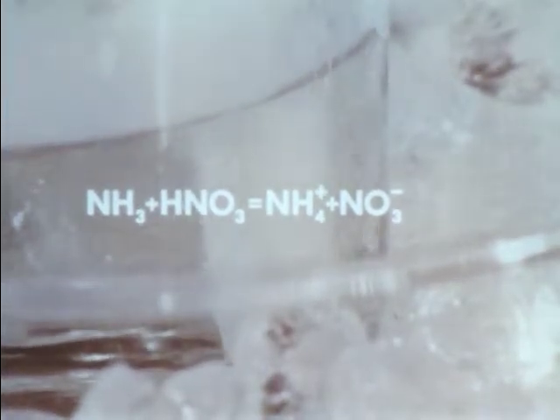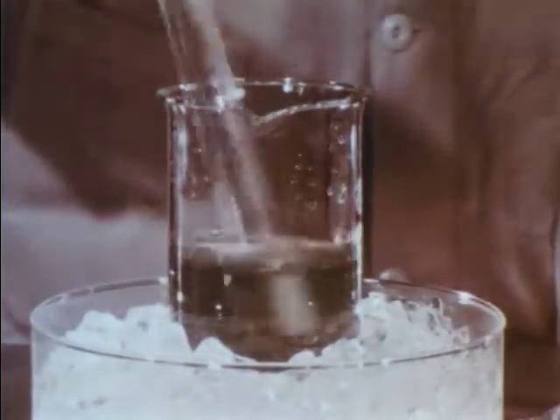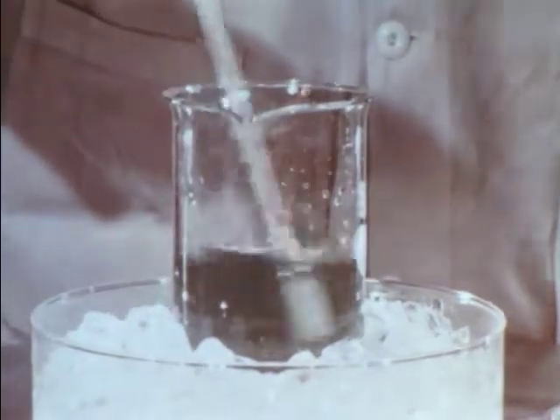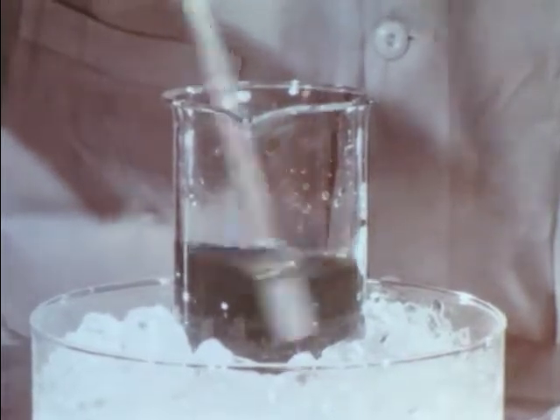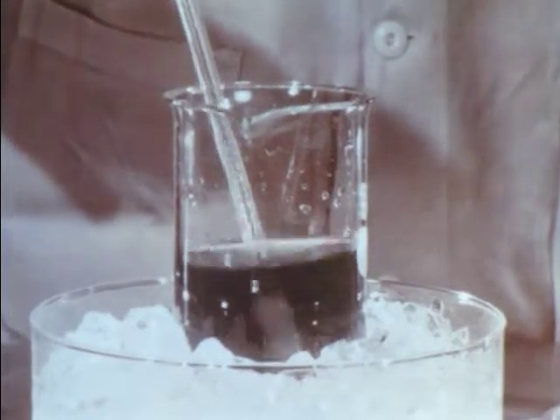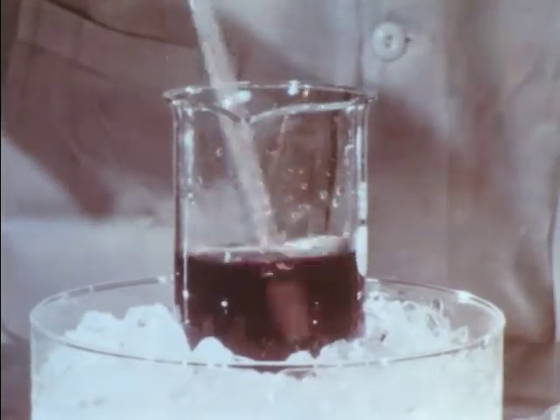The net reaction is ammonia plus nitric acid gives ammonium nitrate. But most of the reaction occurs in the solution, forming aqueous ammonium ions and nitrate ions. As more and more ammonia is introduced, the acidity continues to drop. The methyl violet changes through the intermediate colors, finally becoming violet.